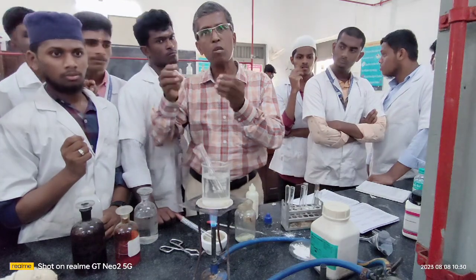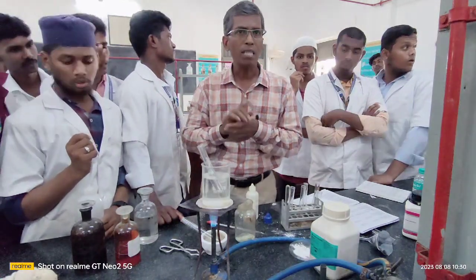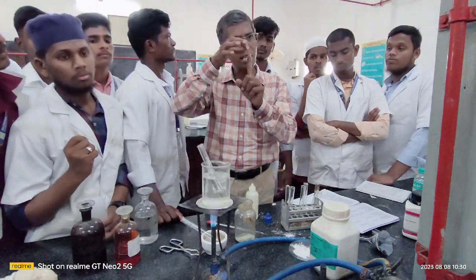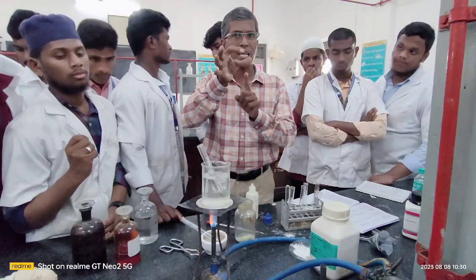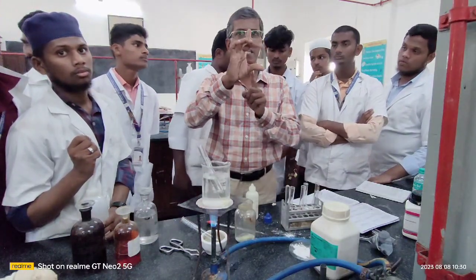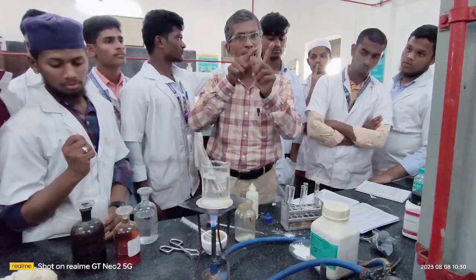You take one more test tube, the given organic compound, and dissolve it in water. You take three different test tubes. In one, you take carbohydrate plus water and dissolve it, because the given organic compound is a carbohydrate and naturally dissolves in water. You keep that ready, and in another test tube, you take Fehling's solution A, and in another test tube, take Fehling's solution B.